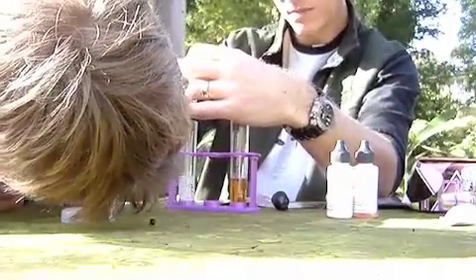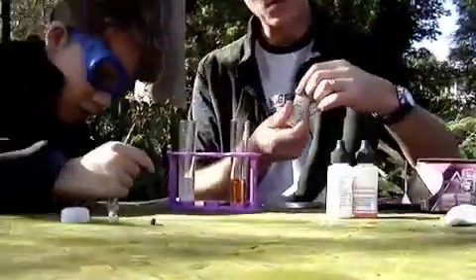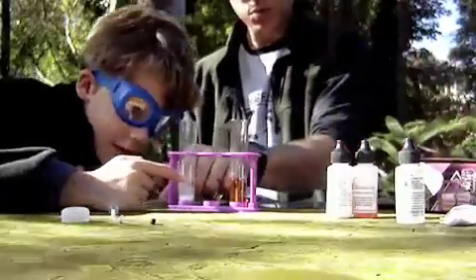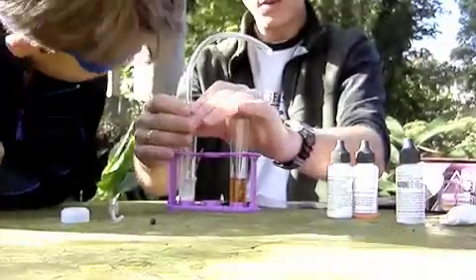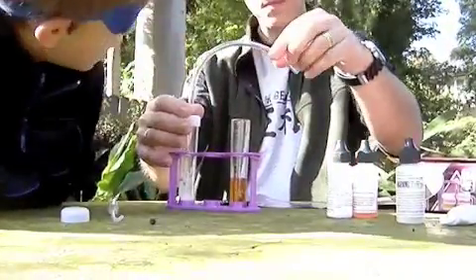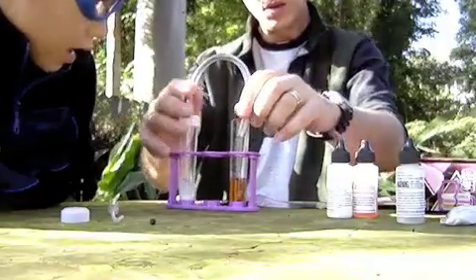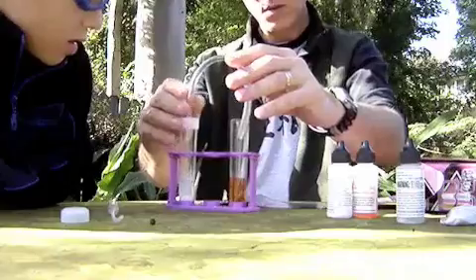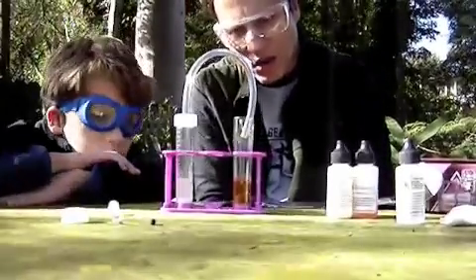The citric acid starts to react with the marble. It's got some mucky stuff so be careful. Put this cover on top of there and we'll put the tube in there. If we've done this right, this will start to change color — and look, it's already starting to change!